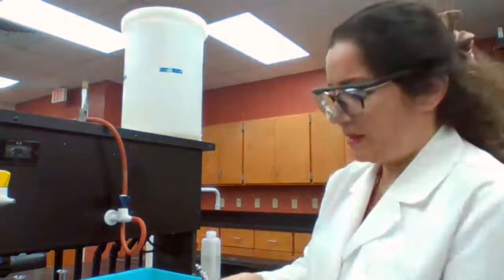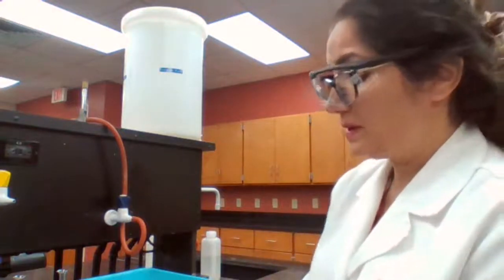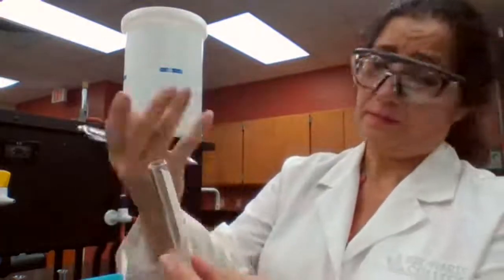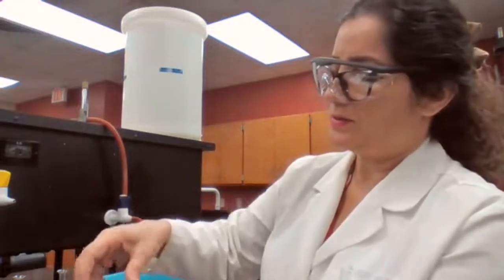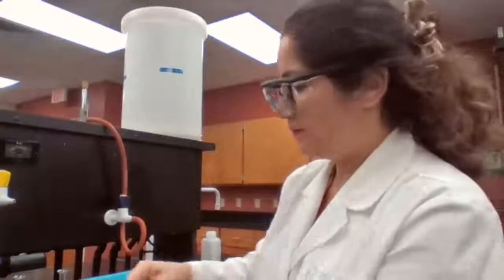Since it's the first time video recording these experiments, sometimes I don't know if it's going to work or not. So I say it's not going to work because it's not easy to read the label and other things. Then it might be visible, so it's worth it to try. So we try to see if we can.